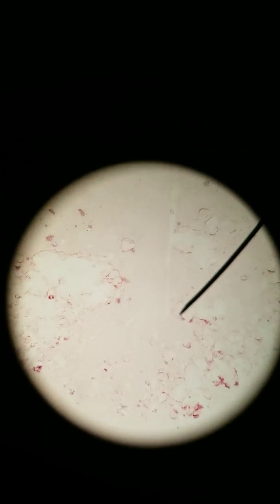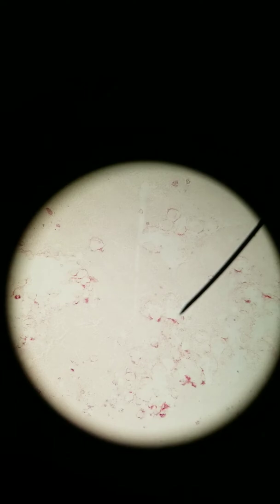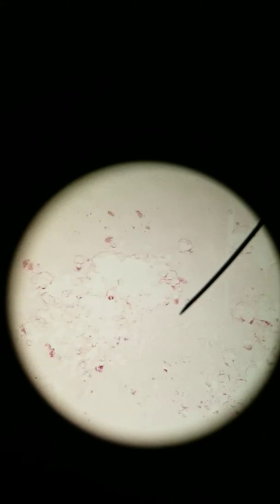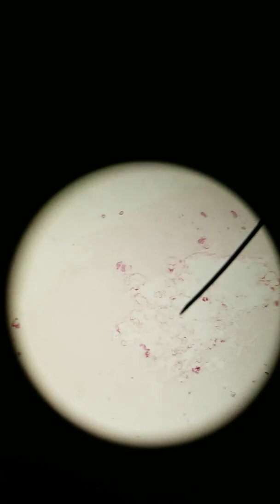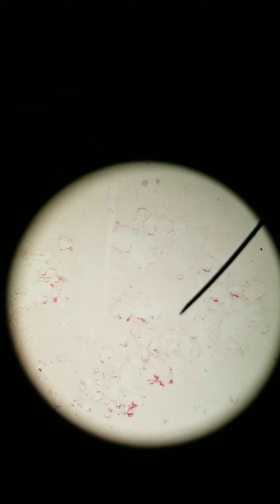Hey everybody, we are going to take a look at the histology of the pineal gland. The pineal gland is in the brain, so it's one of the endocrine glands that you can find in the brain. Not every region of the brain produces hormones — most just have neurotransmitters. The pineal gland produces melatonin.